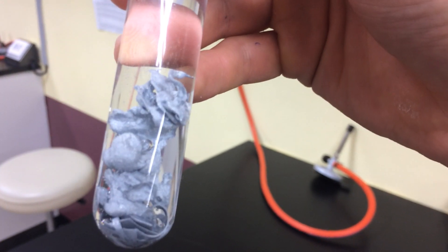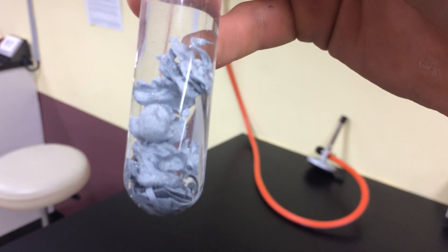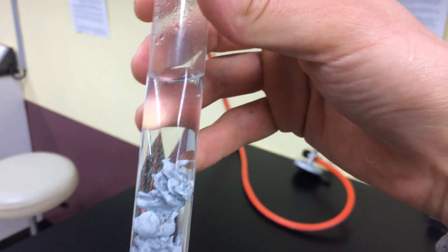Here we have another cool chemical reaction that you can do. I'm reacting zinc with hydrochloric acid.